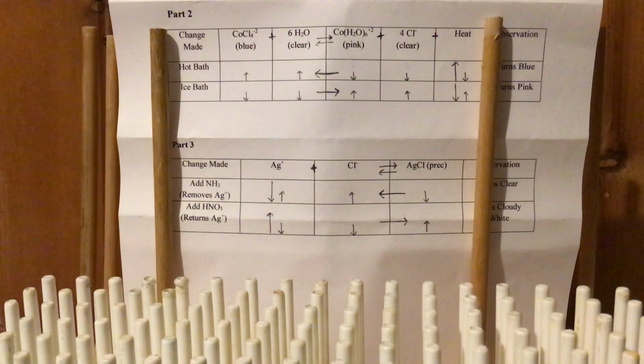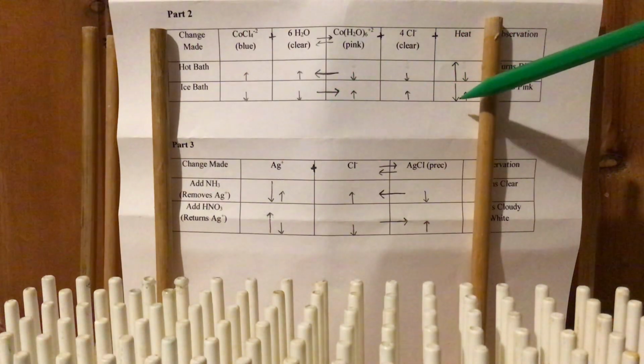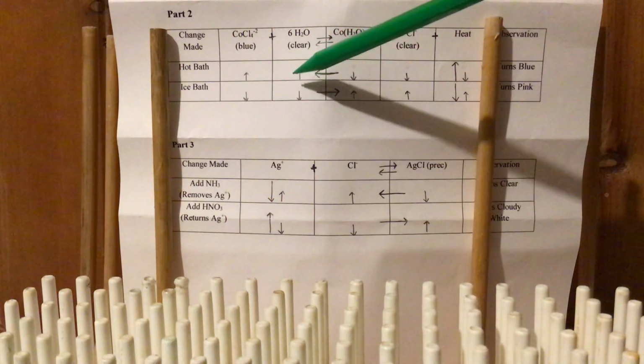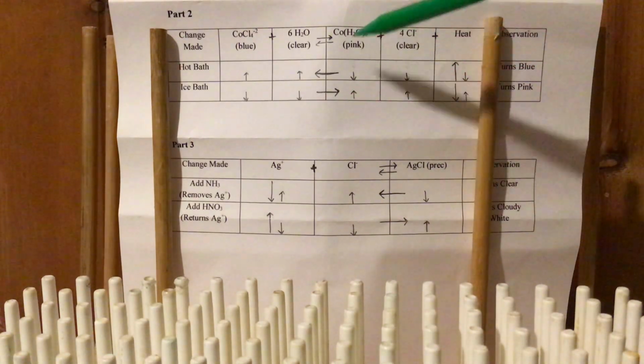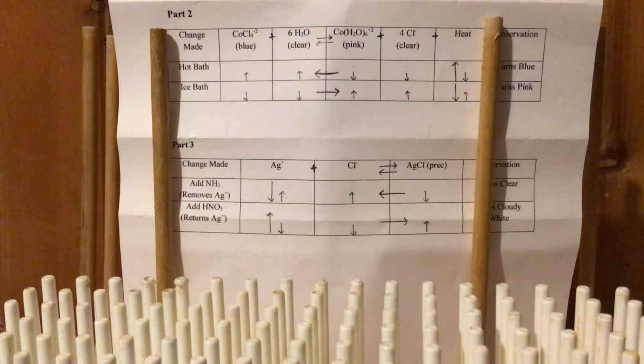Okay, what if you remove heat? Well, it's just going to be just the opposite. So if I take away heat, everything's going to shift more toward it to try to create some to compensate for that. So what happens is the blue thing becomes less, this H2O becomes less, the equilibrium shifts right, and then these two things increase right here. Okay, and notice the blue gets less, the pink gets more, so therefore equilibrium shifts to the right and it turns pink. So with concentration changes or temperature changes, shift away from what you add, shift toward what you take away.